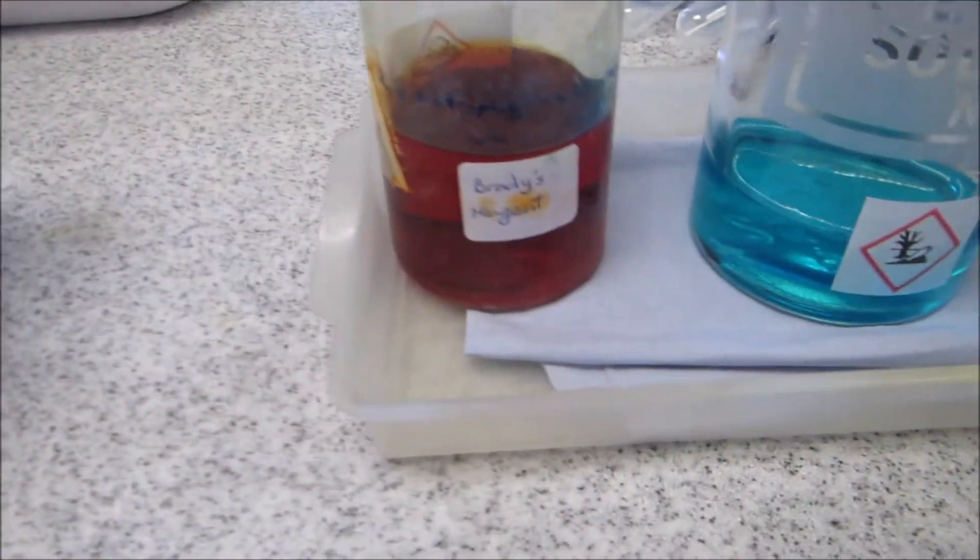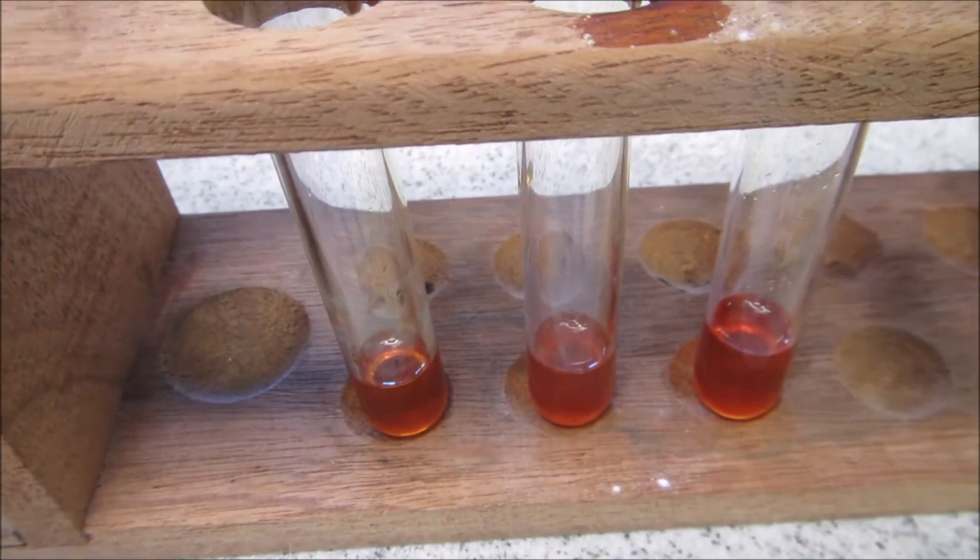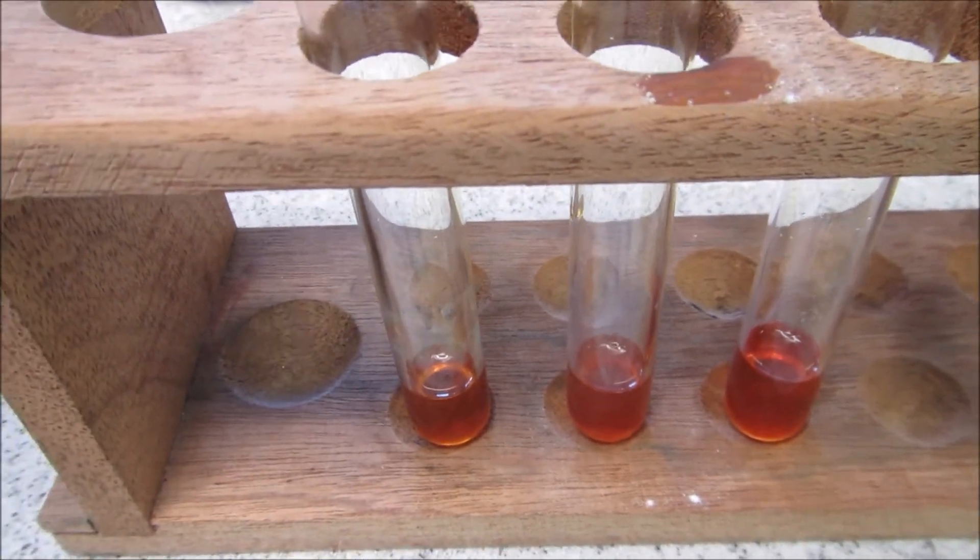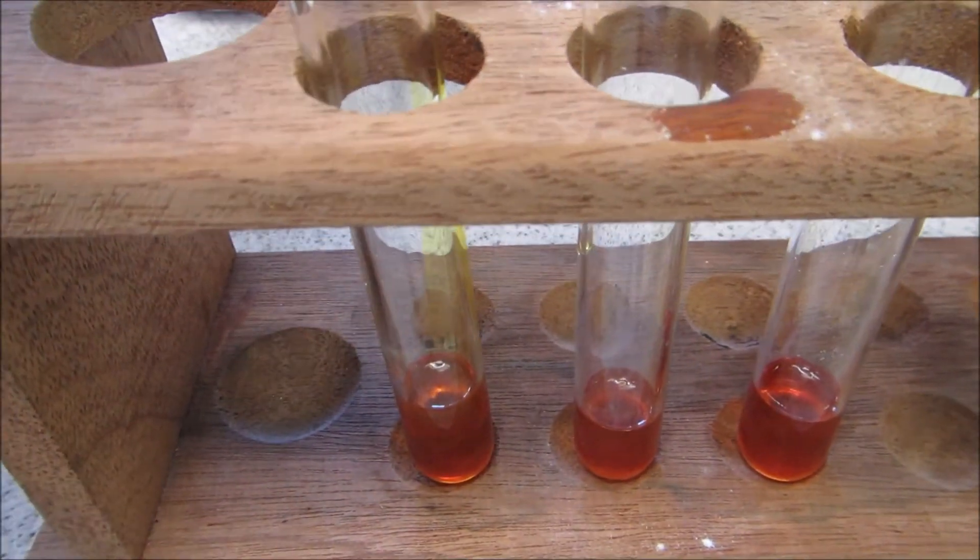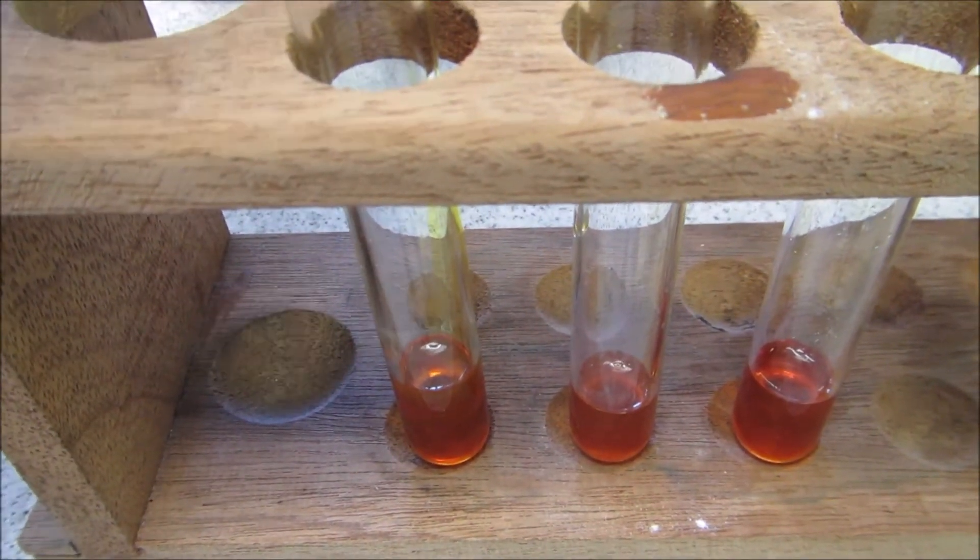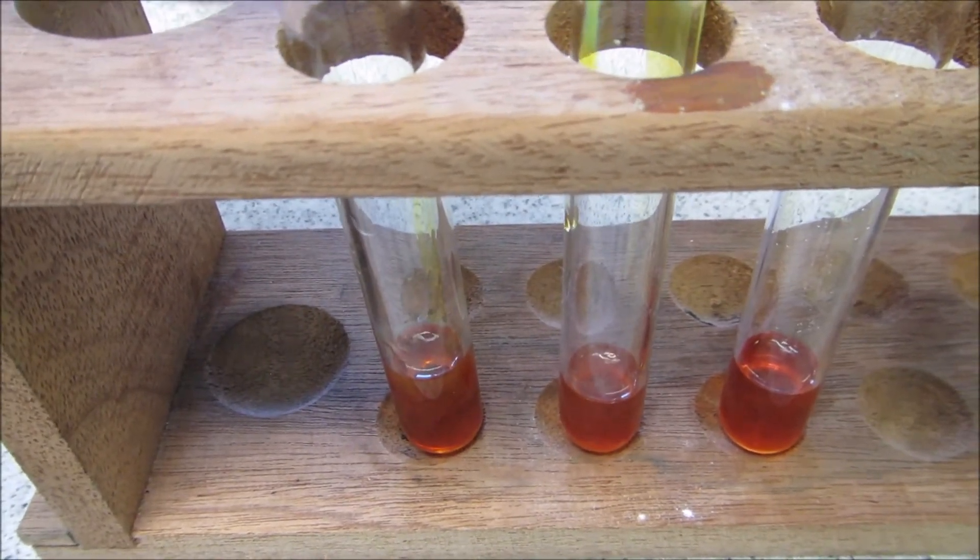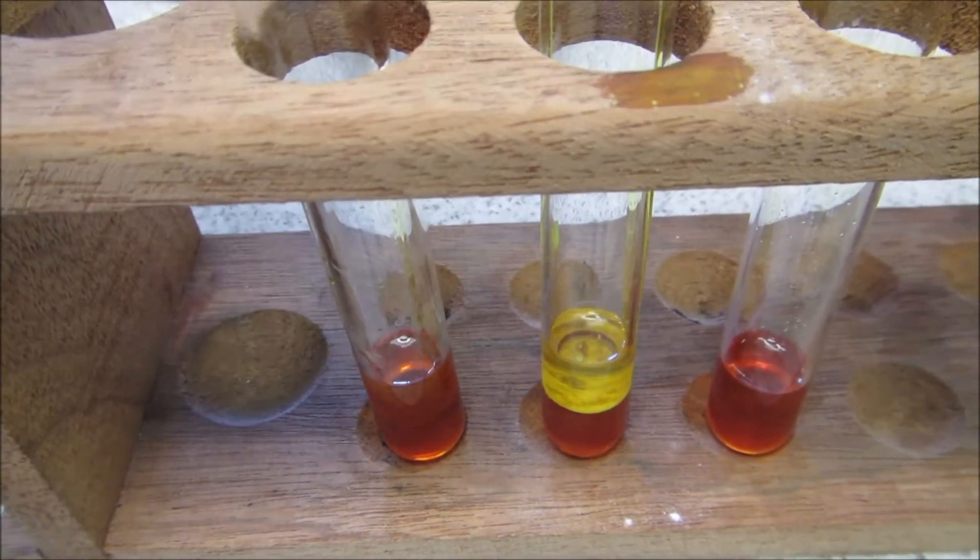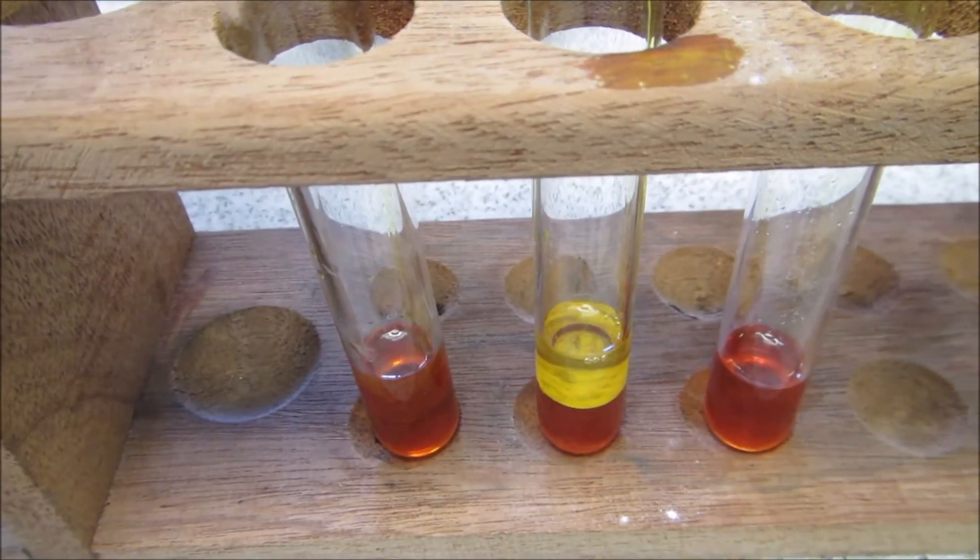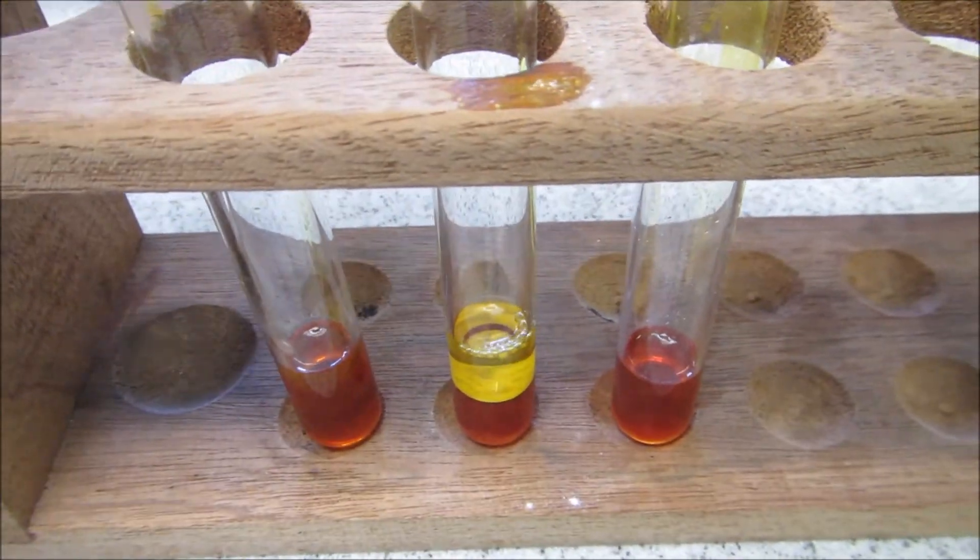First one I'm going to do is a Brady's reagent test. So I've measured Brady's reagent in. I'm now going to add some of three, four and five. So firstly, number three, number four, and lastly, number five.